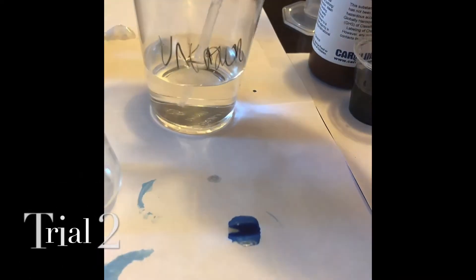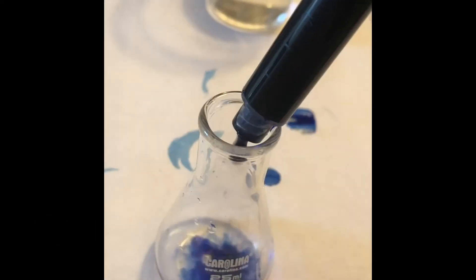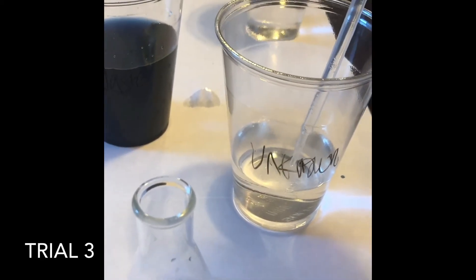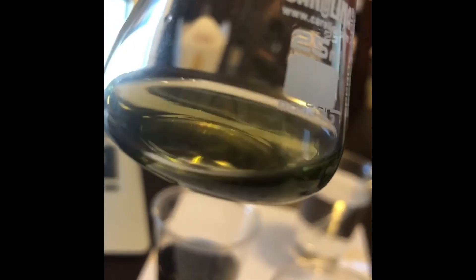For titrating the unknown concentration again, we're going to put 2.0 ml into the Erlenmeyer flask and do the same thing. I might subtract a few drops because it's a little more blue than green — I went past the equivalence point. So I'm going to add 2 ml and continue adding the DCPIP and record it in the data table. More green but it's persistent — about the same color.